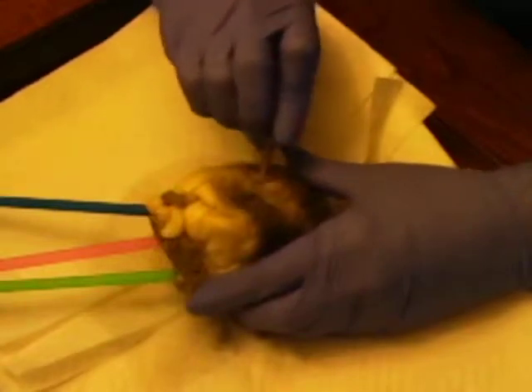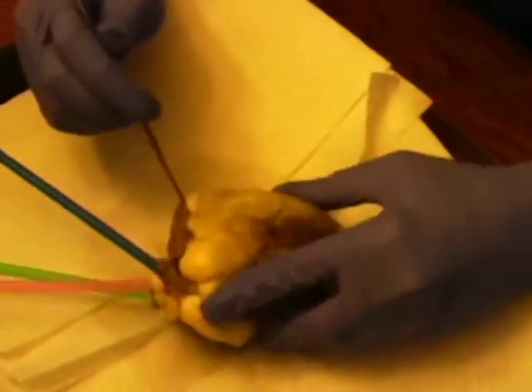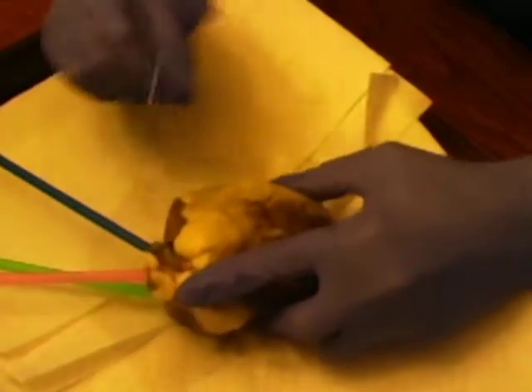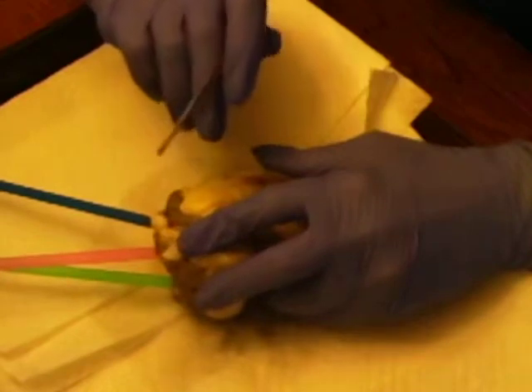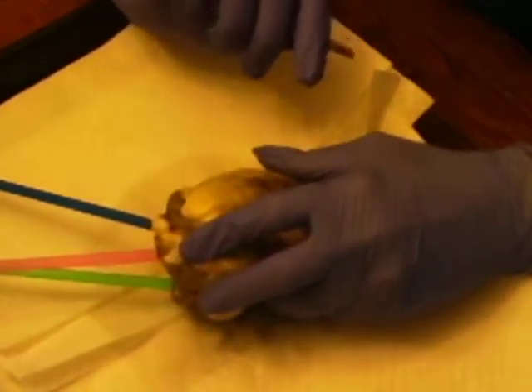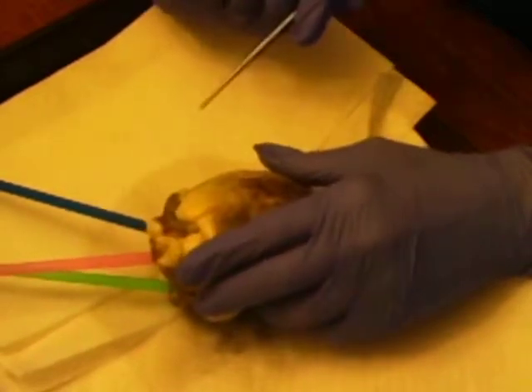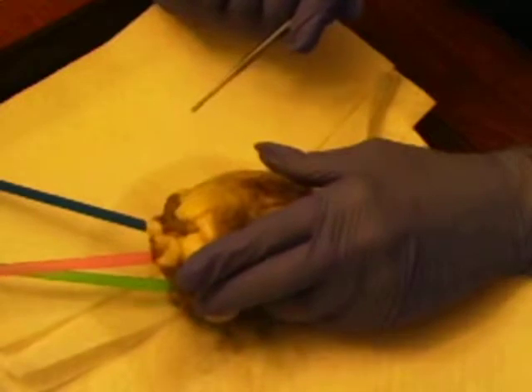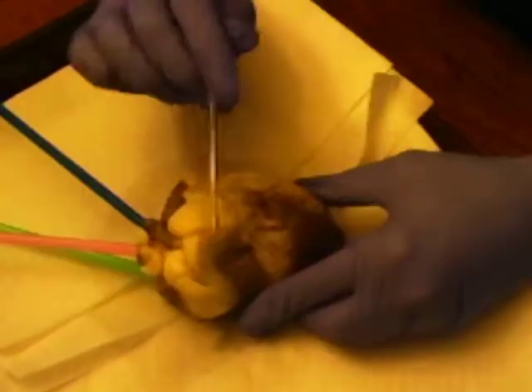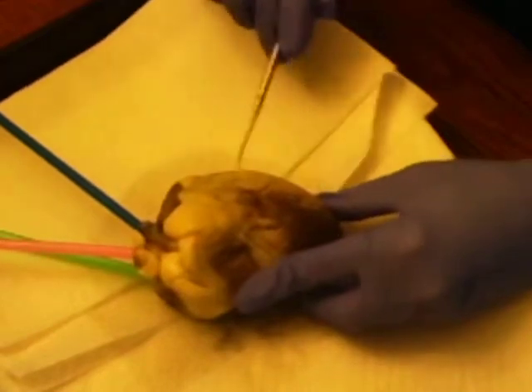This is the auricle of the left atrium, and this right here, this fold, is the auricle of the right atrium. What are they used for? So the right auricle collects deoxygenated blood and pushes it to the right ventricle, and the left auricle collects blood from the lungs and pushes it to the left ventricle. This is the right ventricle here and the left ventricle here.